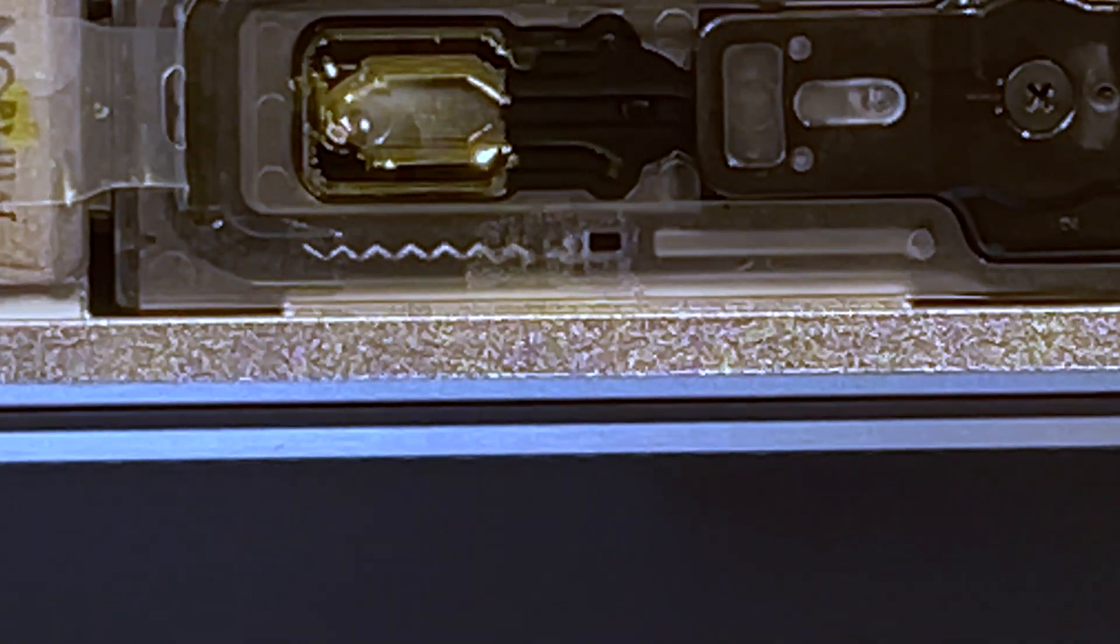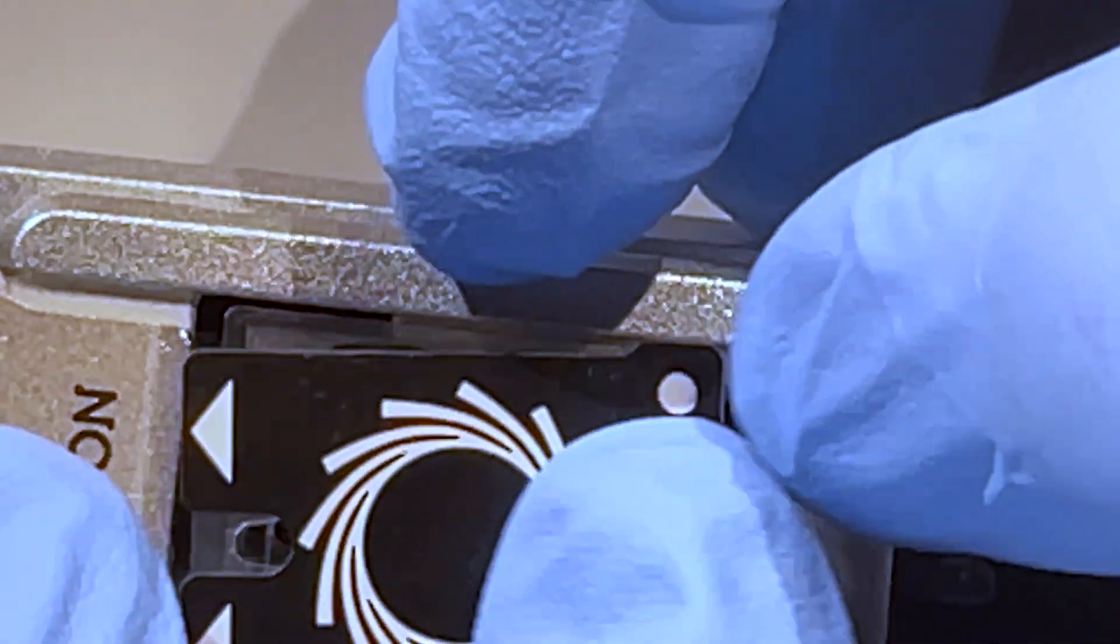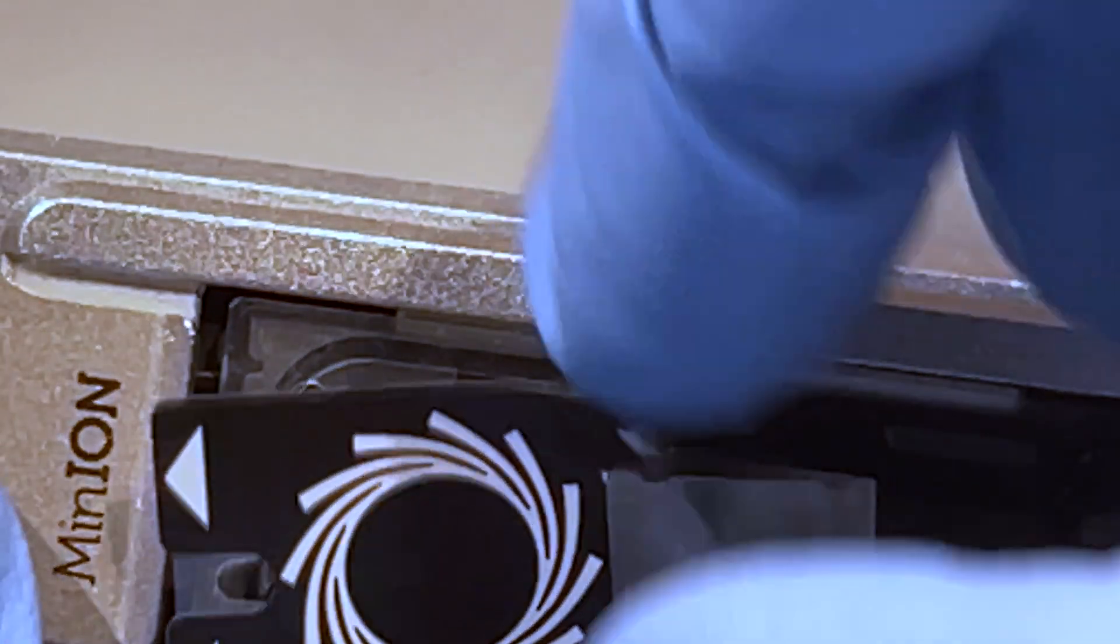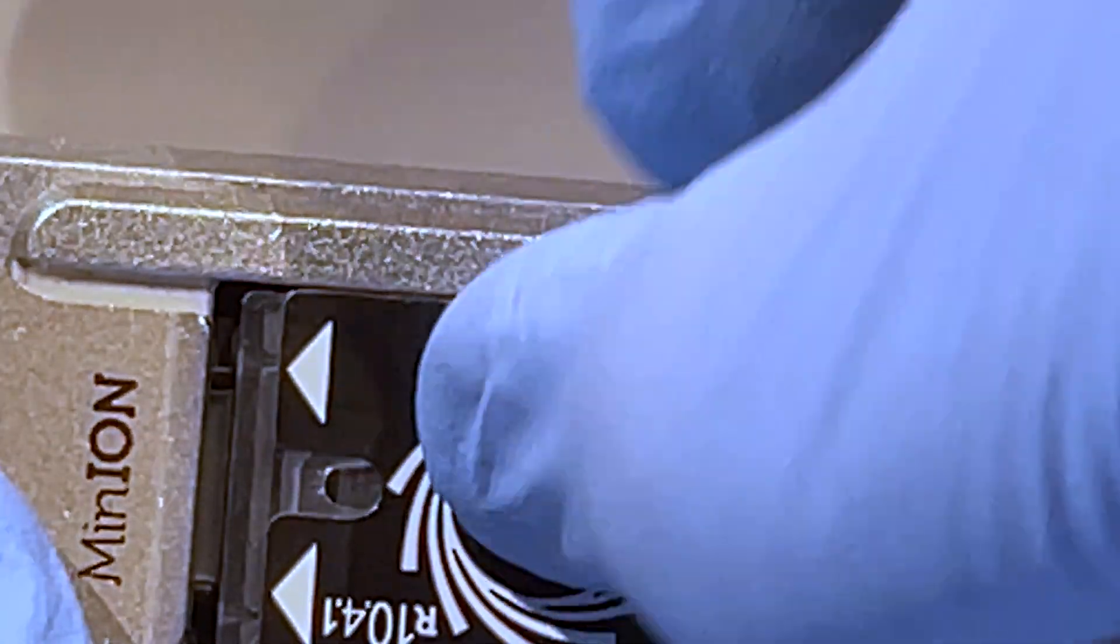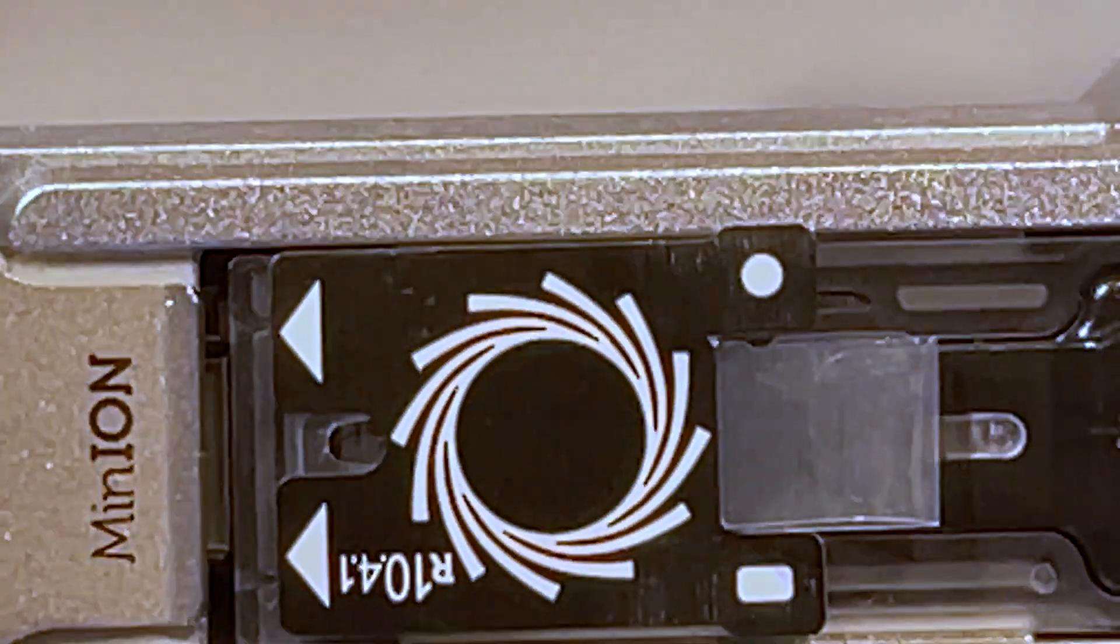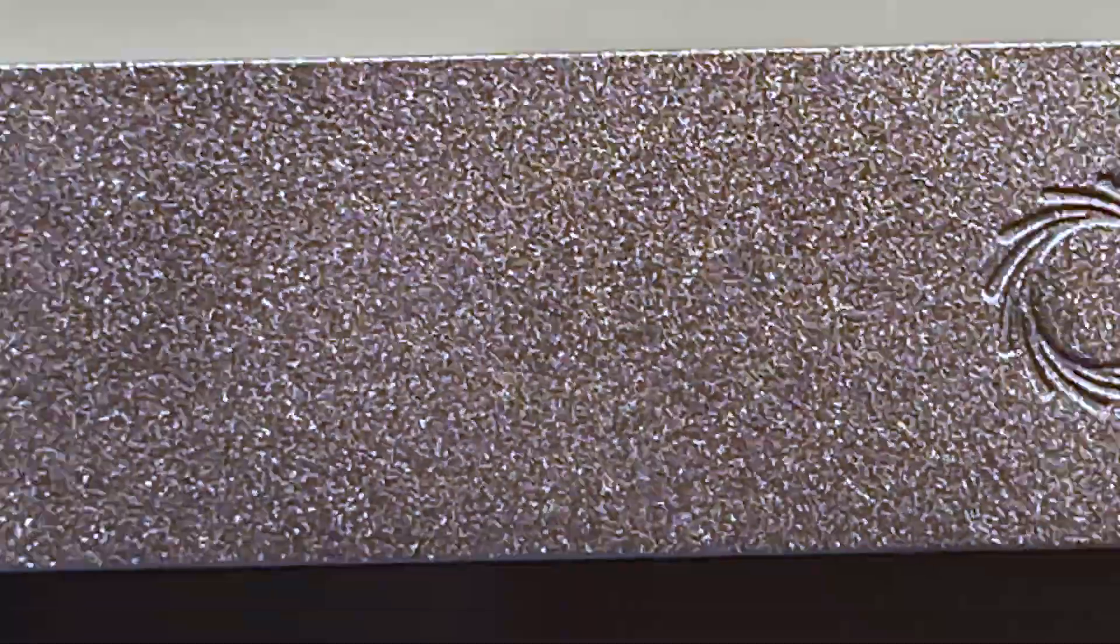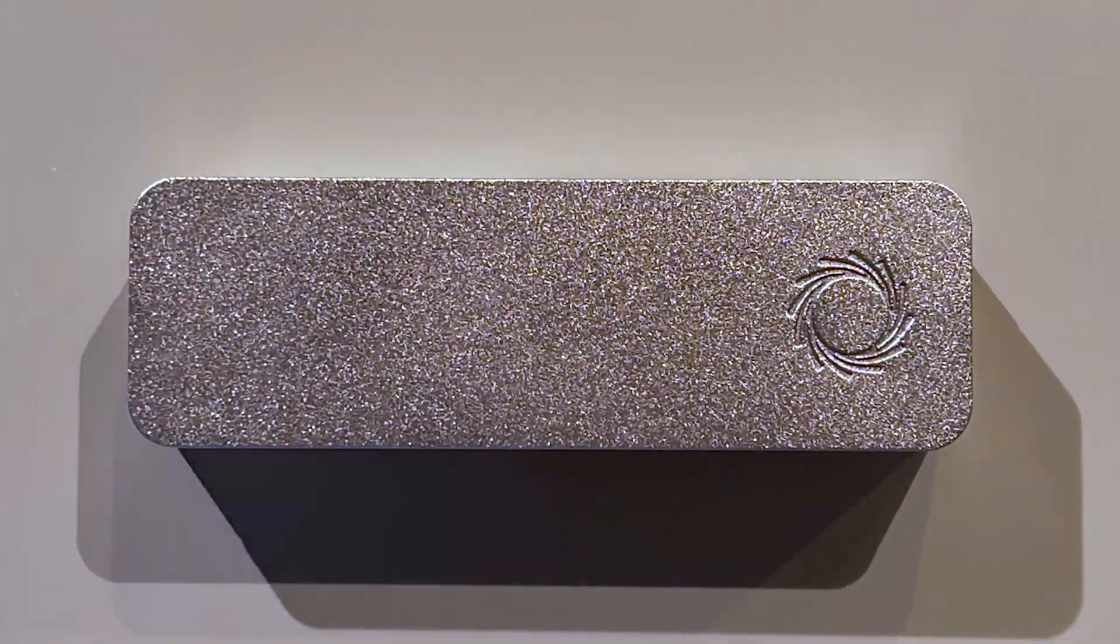Okay, I'm stopping and not worrying about that last half microliter—don't want air. Okay, then I take this tape and I replace it. So I kind of seal it over that way, then fold it back over itself and press it down. And that is ready—ready to load.